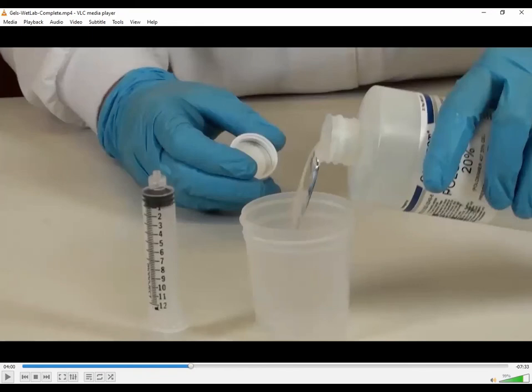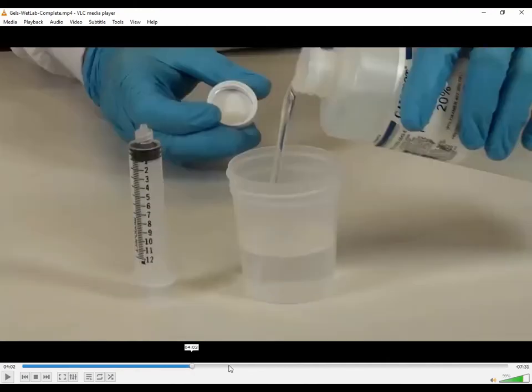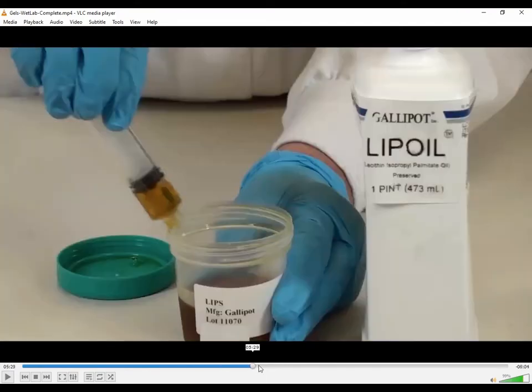You're going to use a 10 milliliter syringe, and you're going to pull up. Do you remember how much for your Poloxamer? 6.5 milliliters. So one of your 10 milliliter syringes is going to have 6.5 milliliters of the clear gelling agent, Poloxamer. You're then going to get another 10 mil syringe and pull up 2.5 milliliters of your lips, which is essentially that oil. So 2.5 milliliters of lips in another 10 mil syringe. So you'll have those 2 syringes.